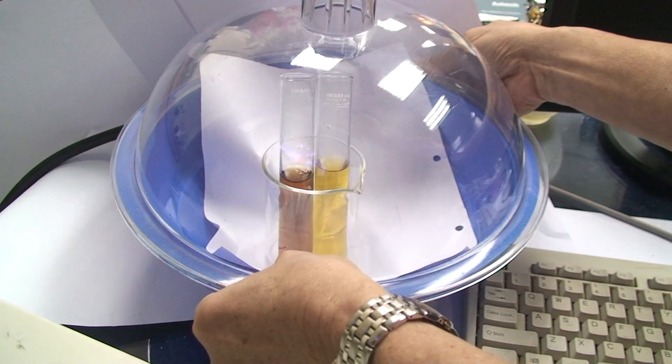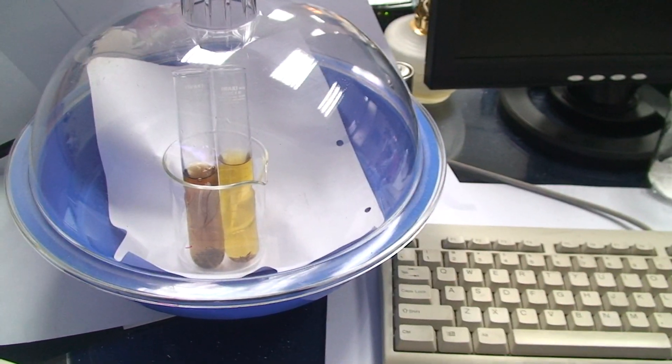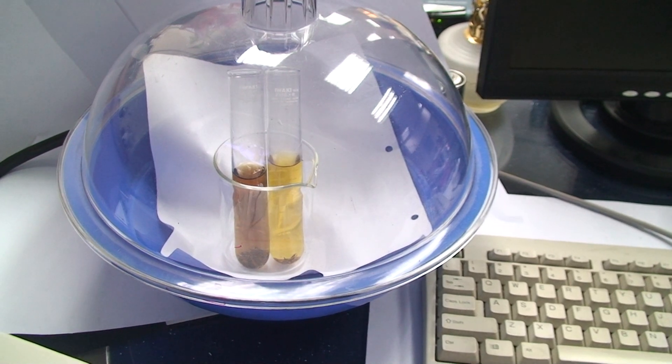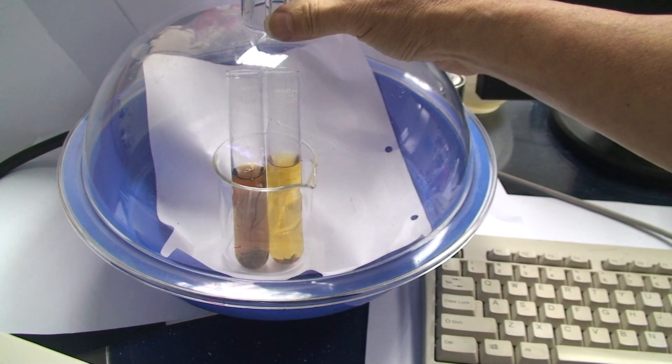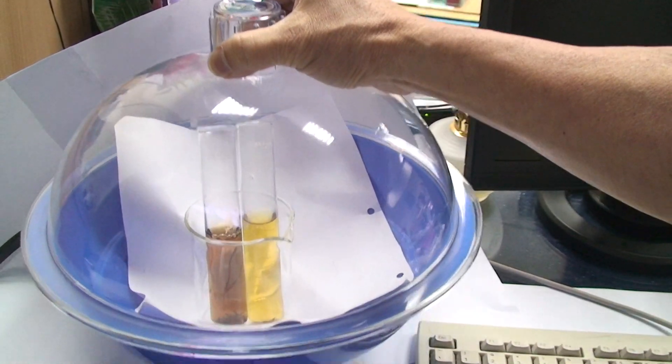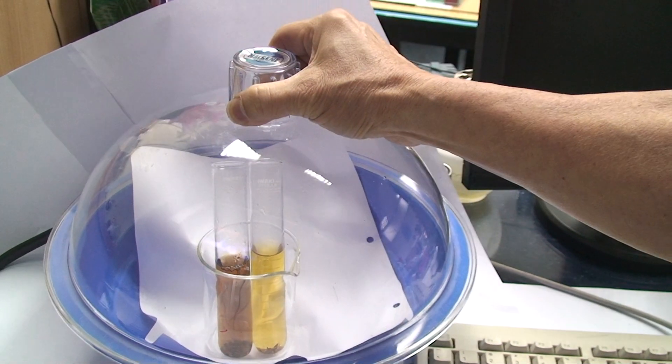And once I suck the air out using this vacuum pump, you'll find it immediately, almost immediately, I can lift this whole thing up, right? Can you see? Alright.